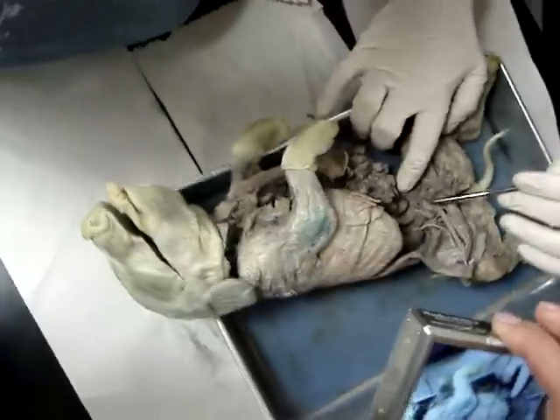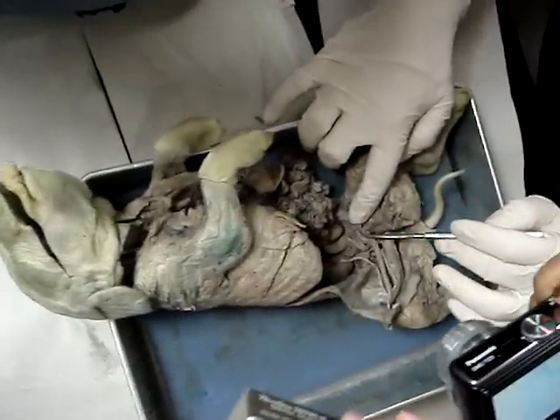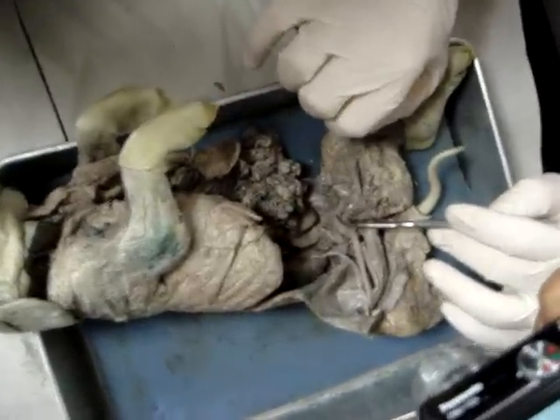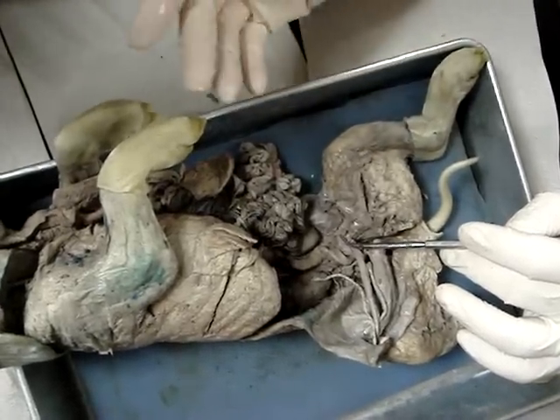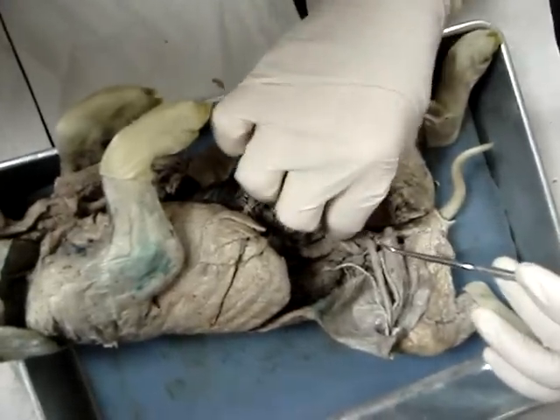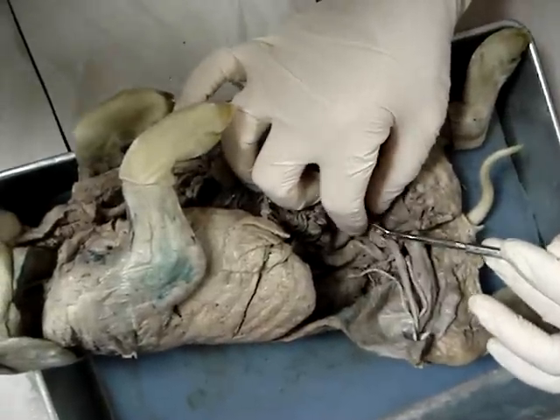Right around the ovary, you can see tiny little squiggles right here — as small as you can think. Those are the oviduct, or fallopian tubes. They're synonymous. Those conduct the eggs to the uterus.